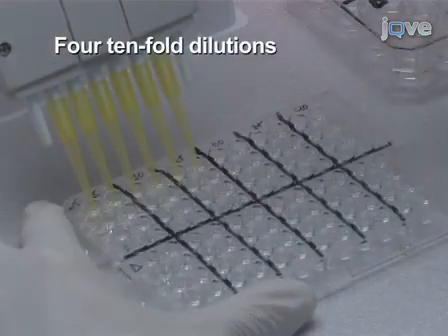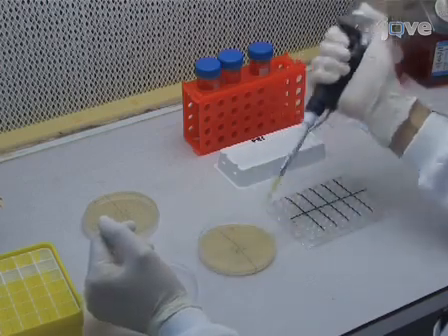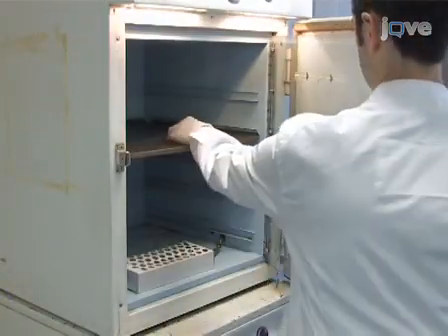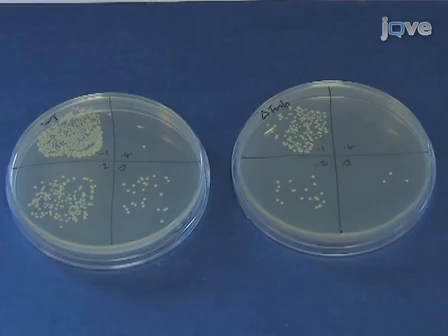Perform serial dilutions of the lysate. To quantify the number of infecting bacteria, collect the lysate and plate serial dilutions on TSA plates. Colony-forming units can be determined on these plates after 24 hours of incubation at 37 degrees Celsius.